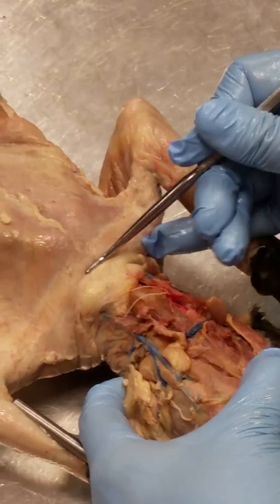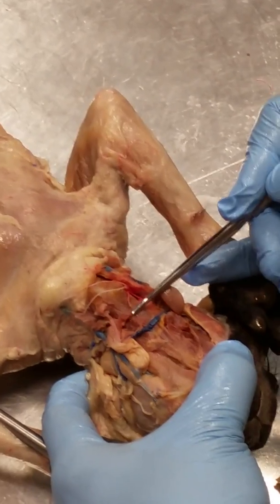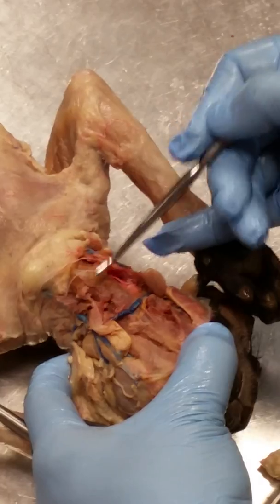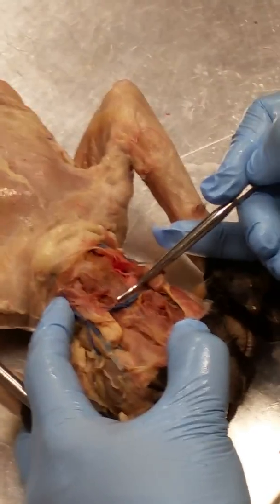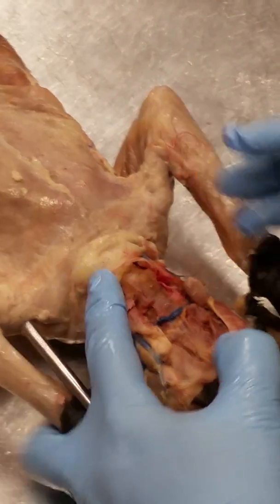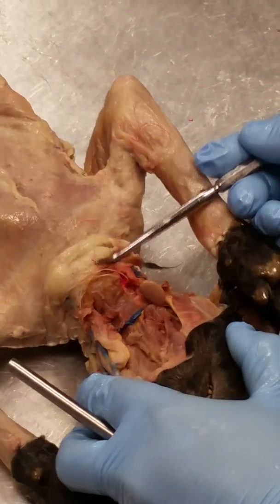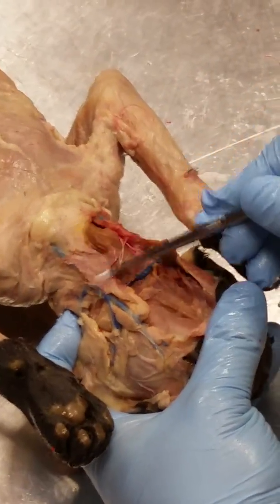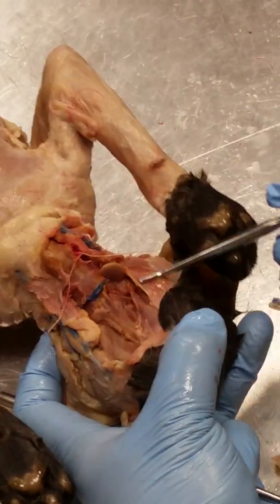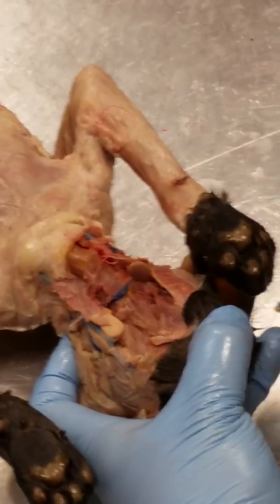Now, from the sternum area to this area where the transverse jugular vein is the hyoid area. So this pair of muscles right here is the sternohyoid. These muscles here that extend from the sternum all the way up to the masseter muscles, sternomastoid. Okay, so sternohyoid, sternomastoid, digastric, mylohyoid. Okay, good? All right, so let's do the shoulder muscles.